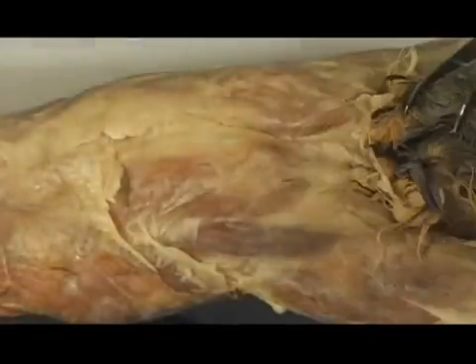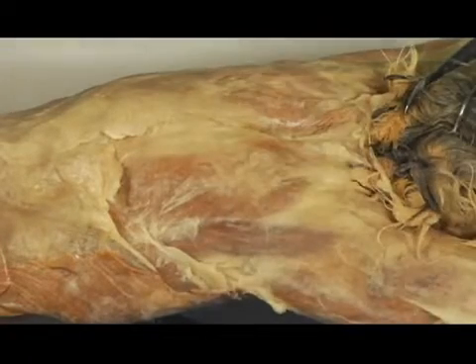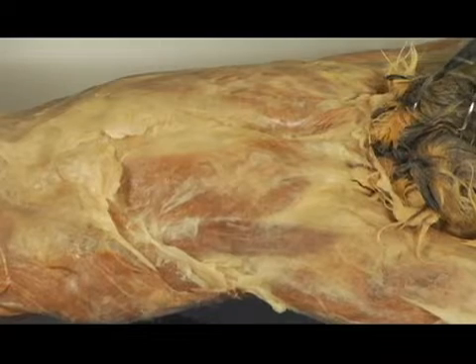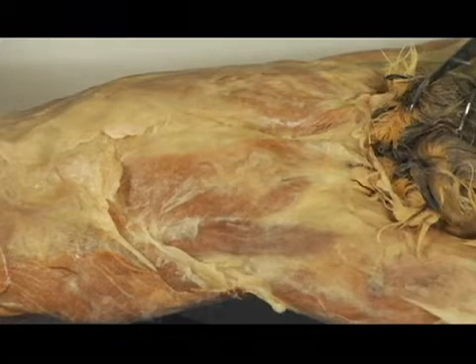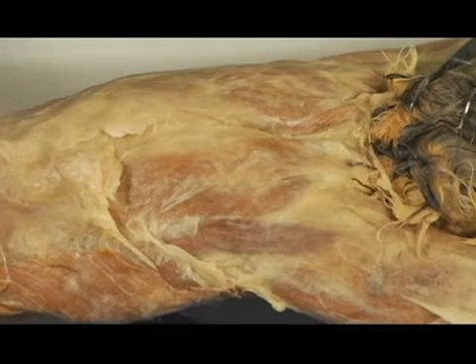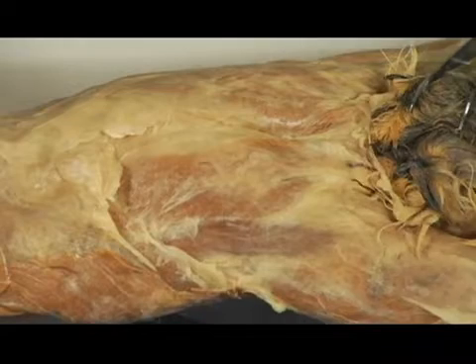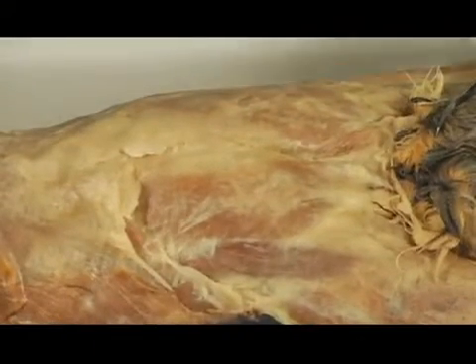Okay, so I've got some tissue. This type of material that I've taken off here, you'll need to account for. You're going to have to maybe keep a paper towel. I don't have one here, but eventually put it in a piece of paper towel and then wrap it all up, and then that can go in the garbage. Okay, we don't want to have a lot of loose pieces of tissue left when we get done with the lab. Okay?